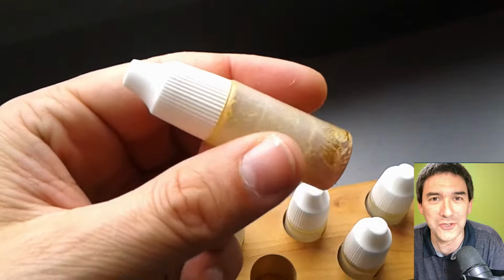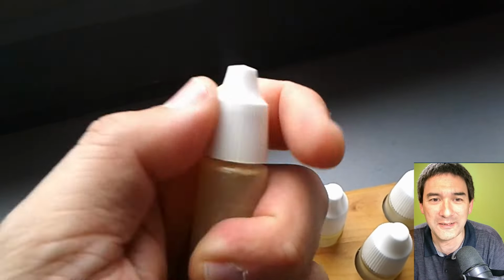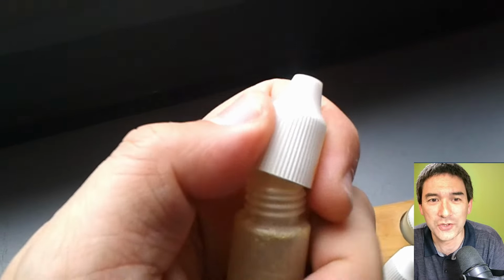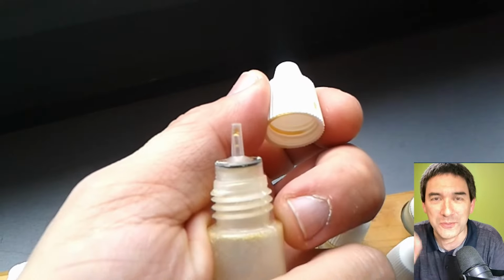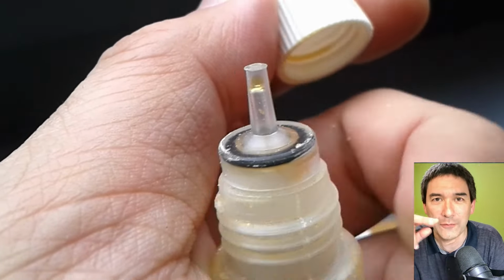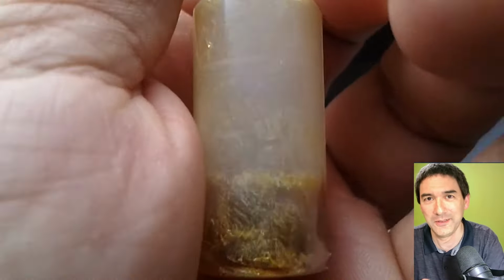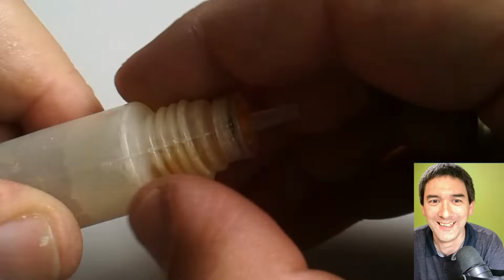Look how solid they have become. I unscrewed it, of course, just to check, and I saw the bottle was never opened before, so it was still sealed off. There's a plastic tip that you have to cut off, but still it turned solid. We didn't throw it away because we kept it as a souvenir.